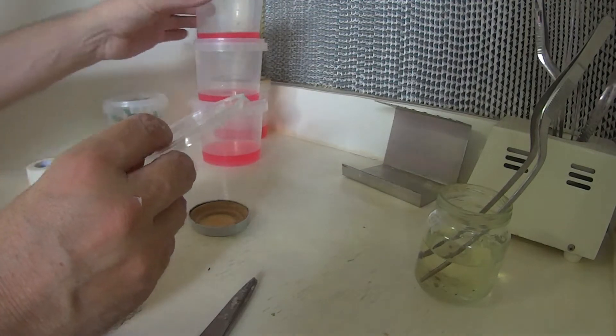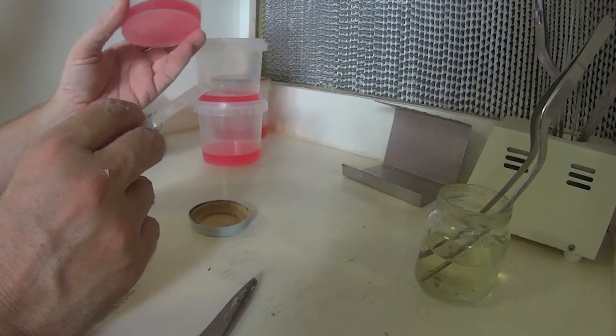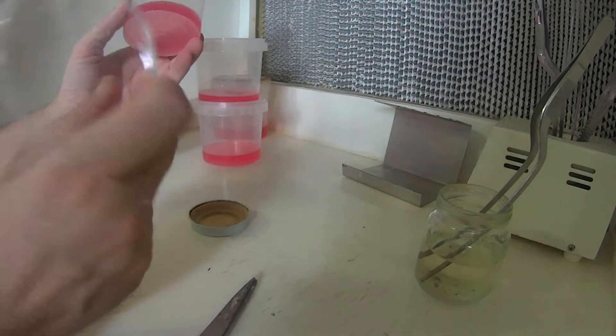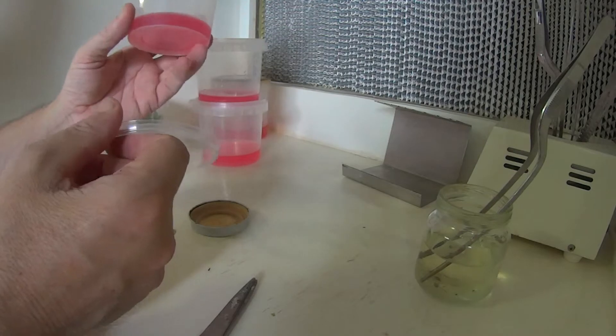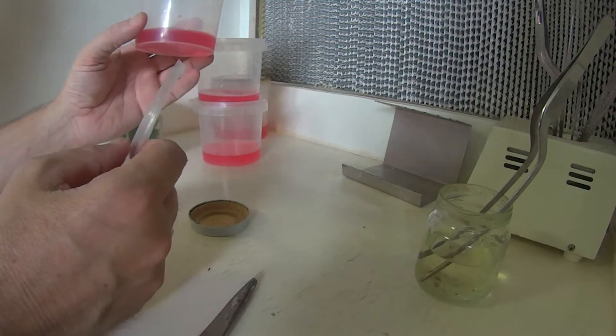And that's basically it. When I go to get my plants to grow roots in this media, I'll put a lid on with a vent spot in it. It just allows gas exchange from inside the container. It is beneficial to the plants as they grow.